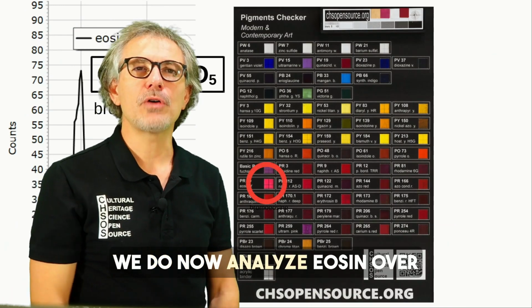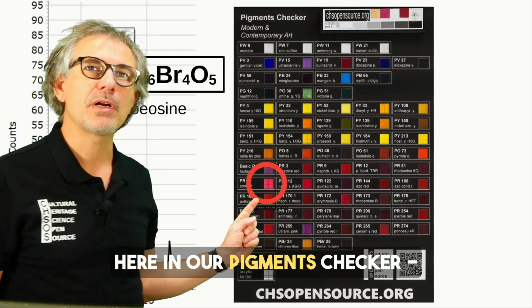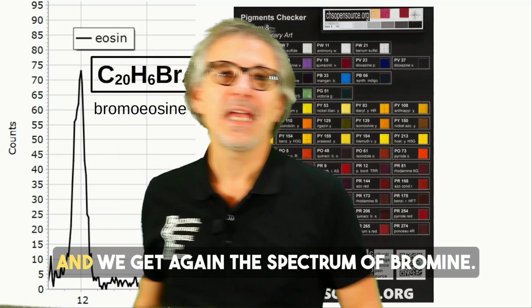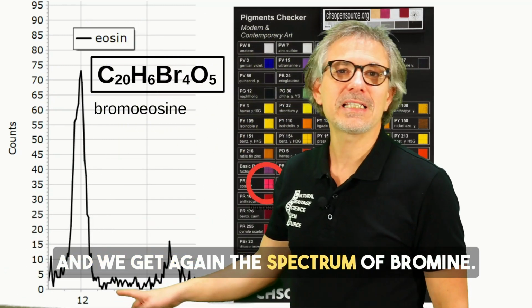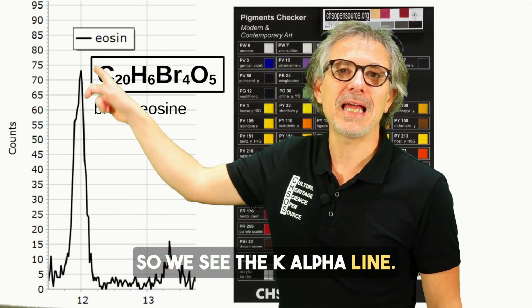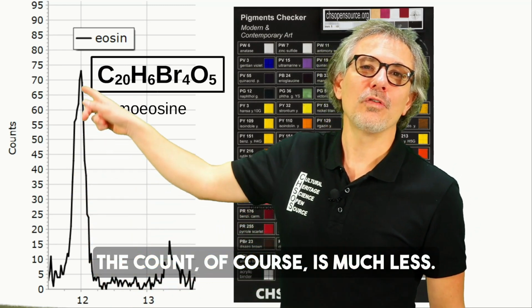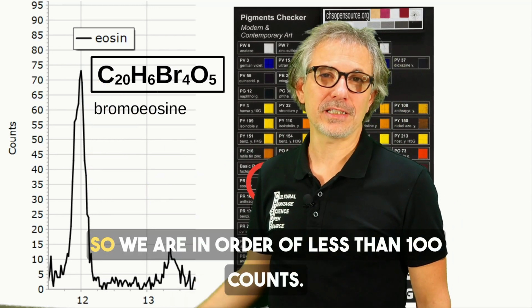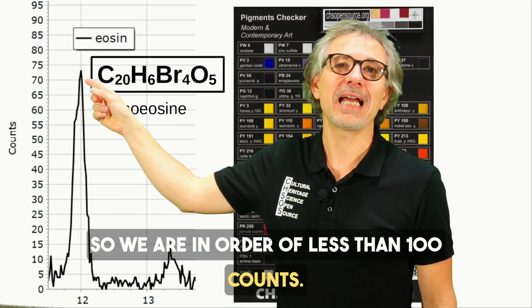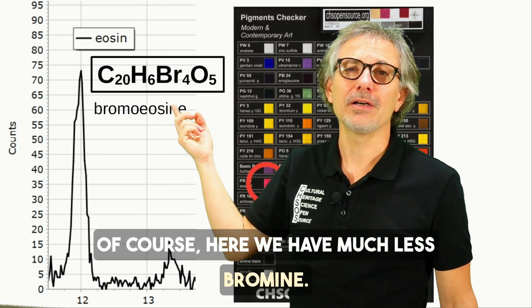We do now analyze eosin over here in our pigment checker modern art for modern pigments, and we get again the spectrum of bromine. So we see the K alpha line, we see also the K beta, but the counts, of course, is much less. So we are in the order of less than 100 counts. Of course, here we have much less bromine.